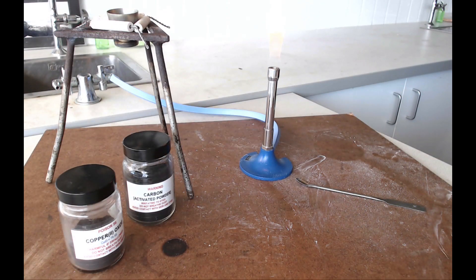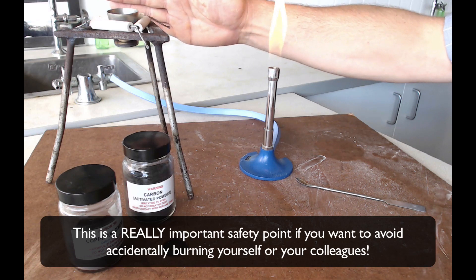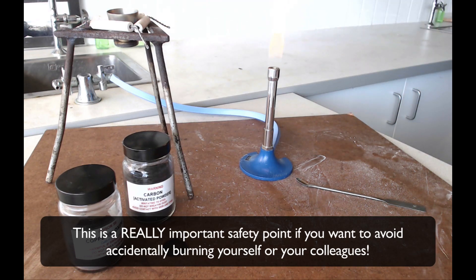Now once you've stopped heating your mixture you want to let it cool right down. Now how do you know if it's cooled right down? Well if you put your hand near it and it still feels warm then it's probably too hot to handle and what you shouldn't be doing here is trying to run the thing under cold water or anything like that to help it cool down. So just let it cool down at its own pace.